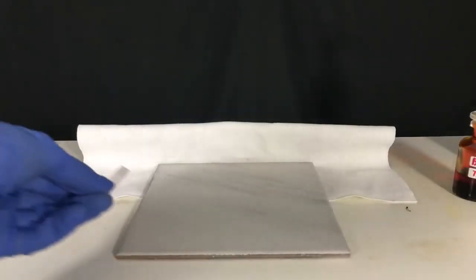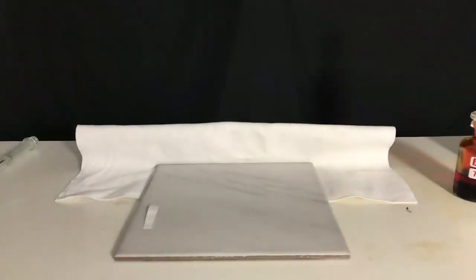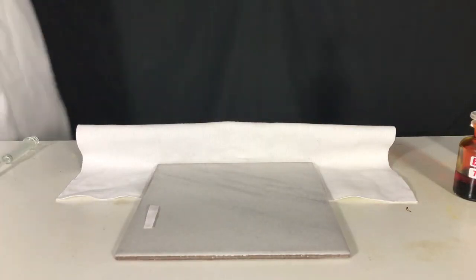We then start off by putting a piece of potassium iodide starch paper onto the tile. A mixture of potassium iodide and starch is used to indicate halogen vapors.